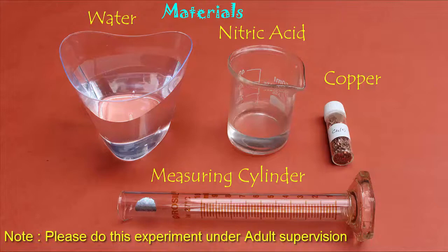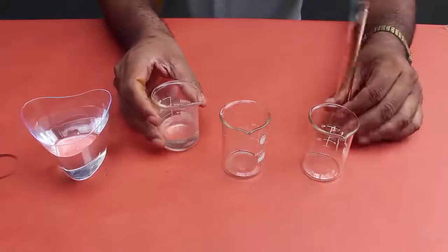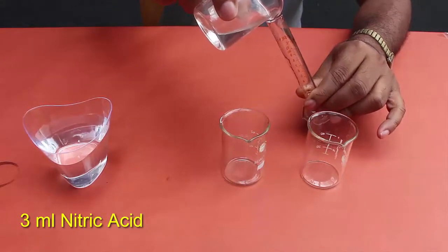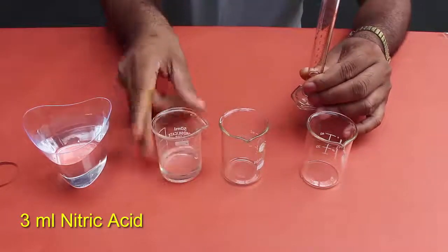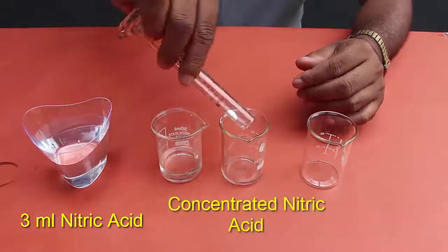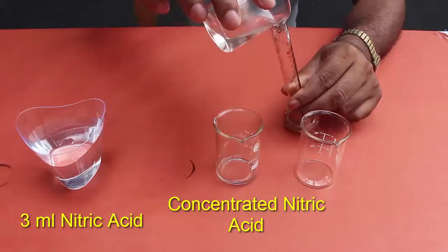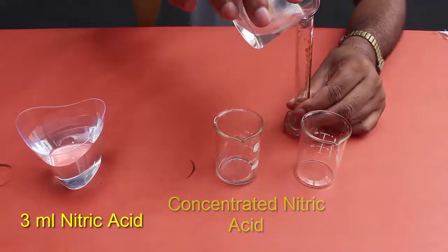First we will make the acid solution. We are going to take 3 ml of nitric acid, pour it into the measuring cylinder — exactly 3 ml — and then pour it into the first beaker. This is concentrated nitric acid.